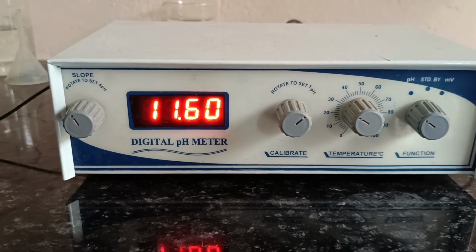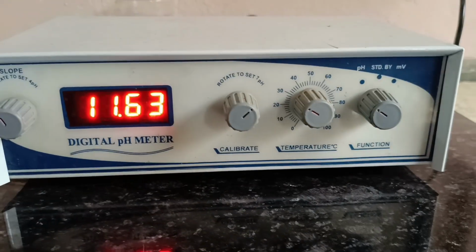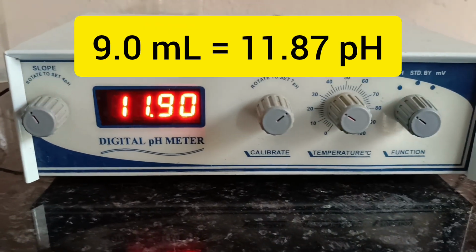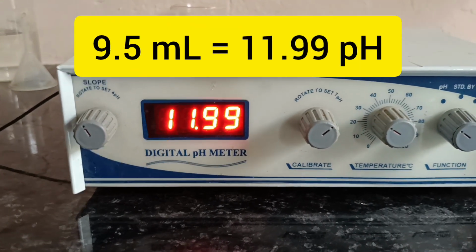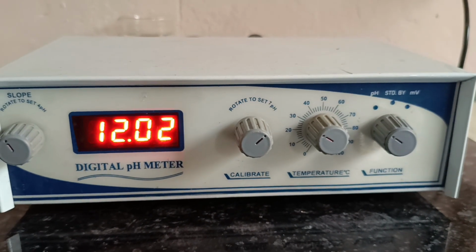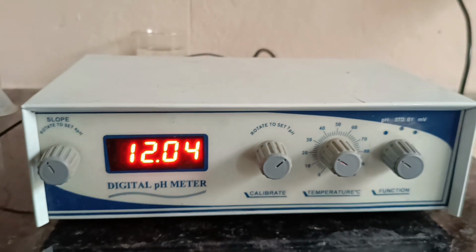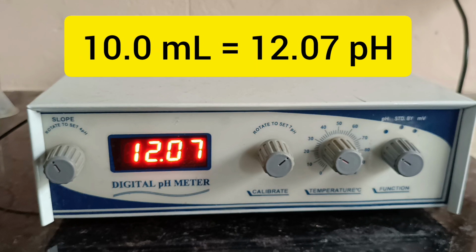So this is after the neutralization point, and it is a sigmoidal curve. 11.63 pH at addition of 8.5 ml of the NaOH solution. 11.87 on addition of 9 ml of the solution, and now 9.5 ml shows 11.99 pH. And finally we are taking the readings till a constant sigmoidal curve is obtained. When 10 ml of the solution is added, the pH value is 12.07.